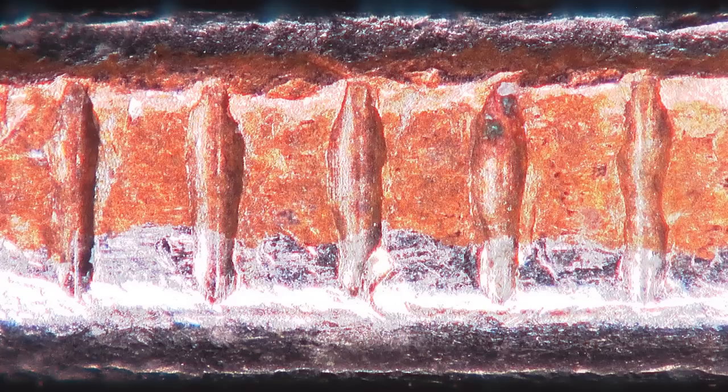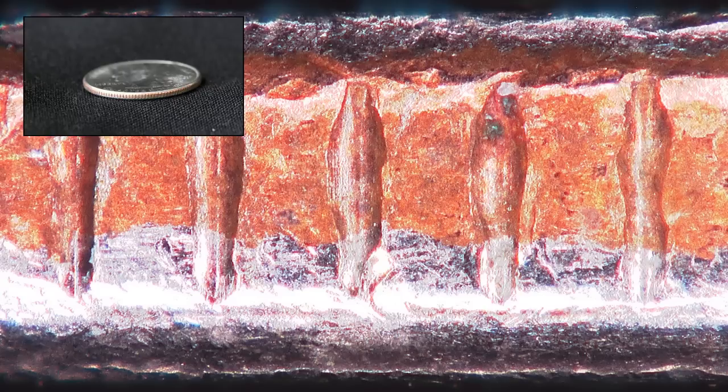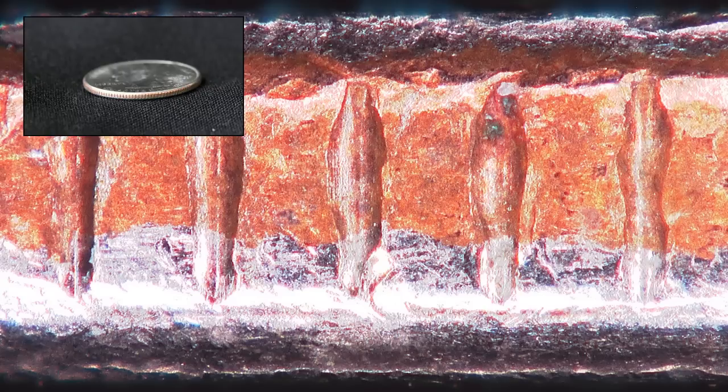Image 2: a baseball. You can kind of see the stitching on the left side of the image. And image 3: this is the side view of a quarter.